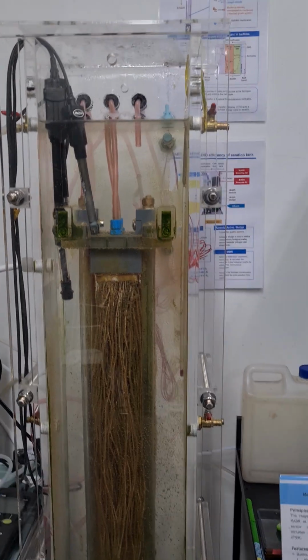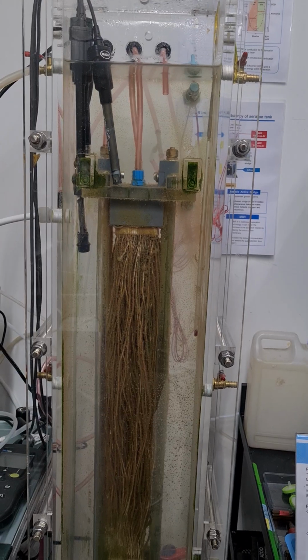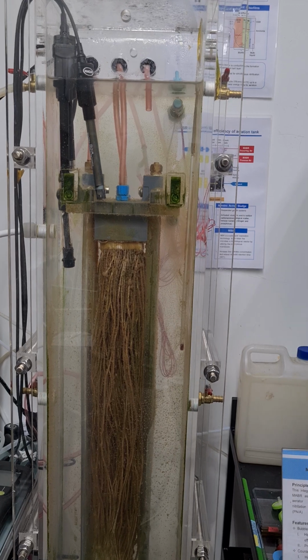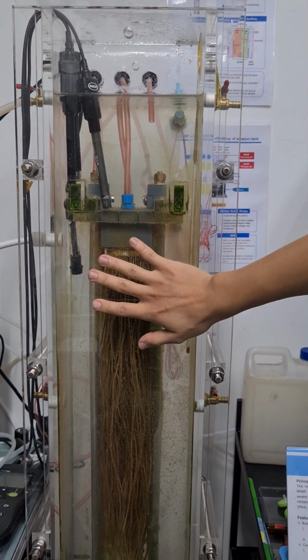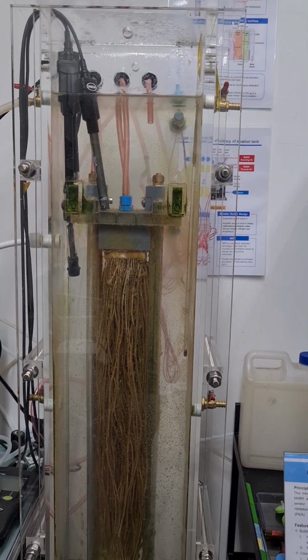So how do you supply the air? What's the flow rate that you give? The flow rate is very small. For now, maybe less than 100 milliliters per minute. But actually, it depends on the surface area of your membrane. So of course, if you have a very large surface area, you need more air supply.